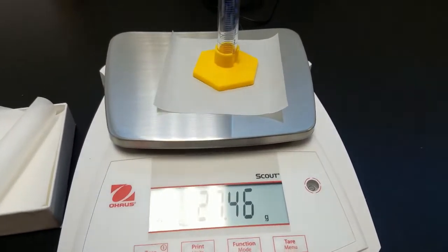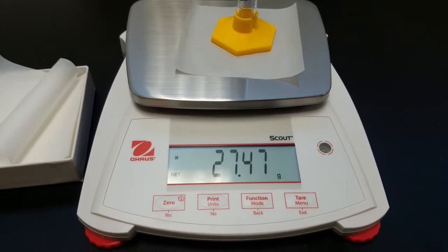Now we're going to take the mass of our empty graduated cylinder.